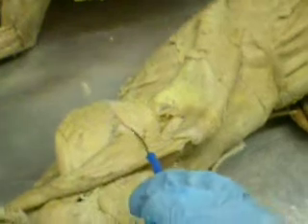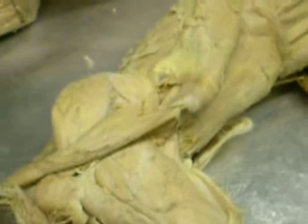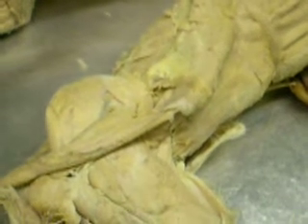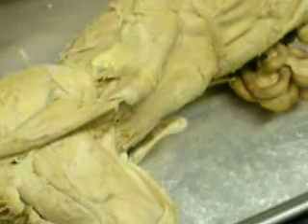Is this teres something? Oh, it's right here? That's the teres major — that's just the border. That's part of the spine, can you see? It's right here. That goes all around the bottom. What's this? And then on the other side — that's the infraspinatus, it's part of it.